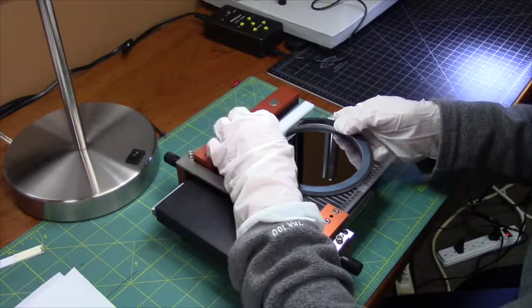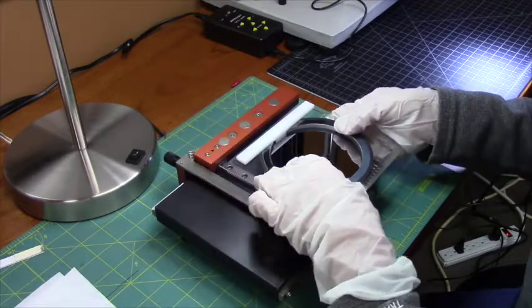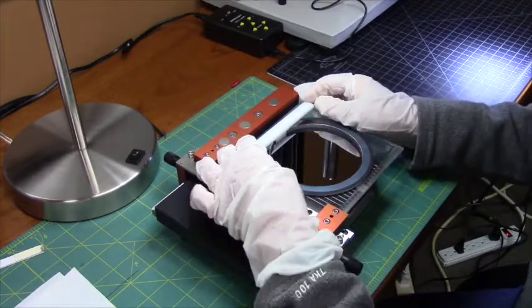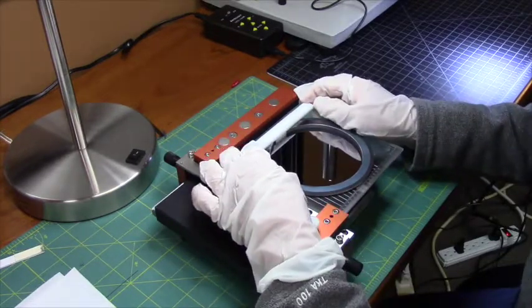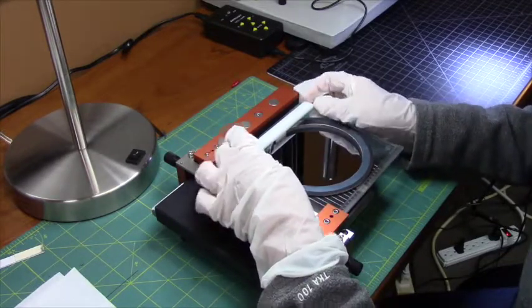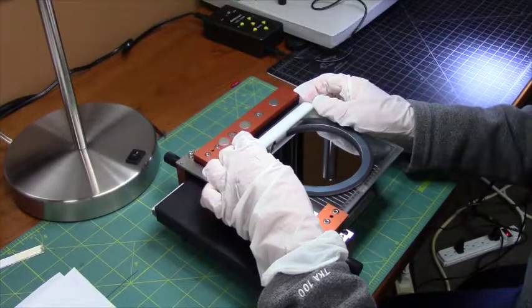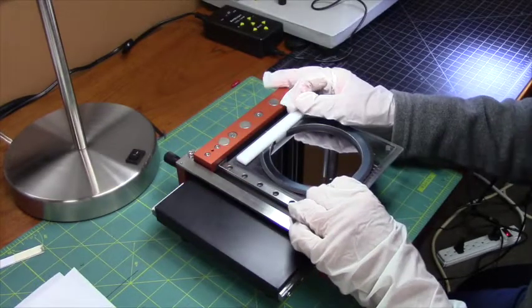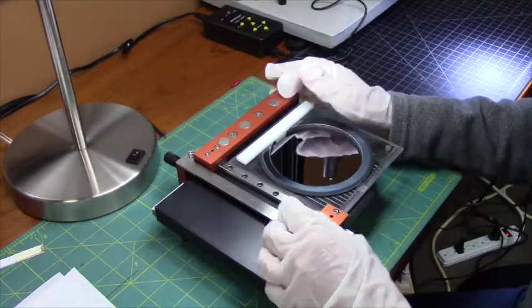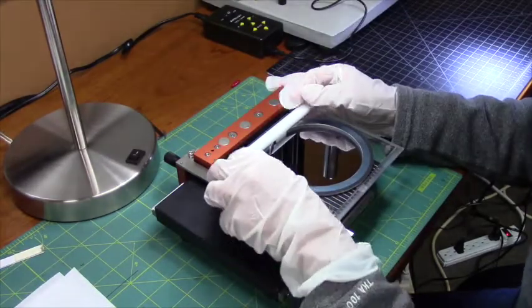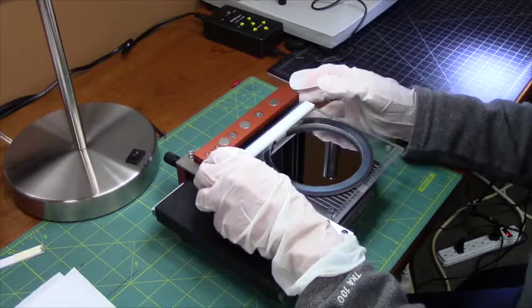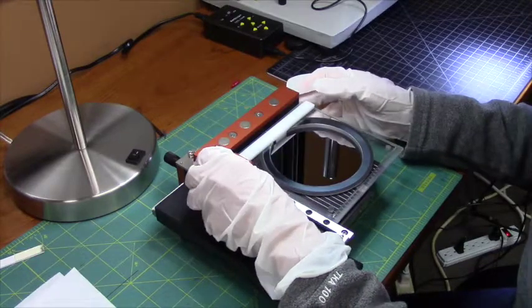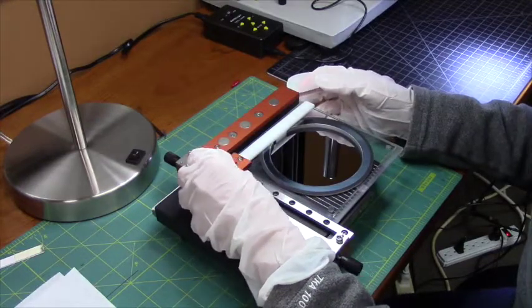I am going to put my magnetic hold down firmly against the flat of the wafer. I am going to use my scribe stop to define the length of the scribe.